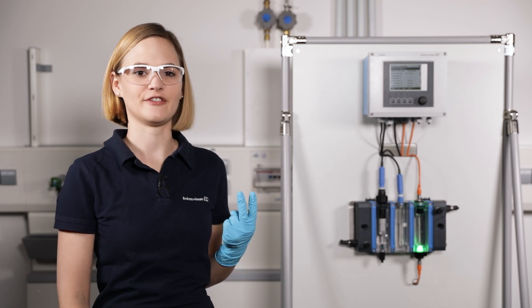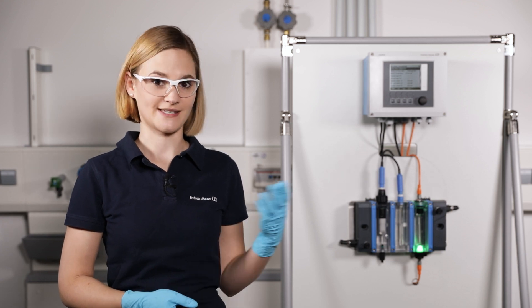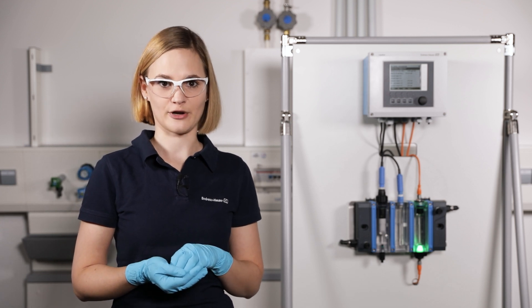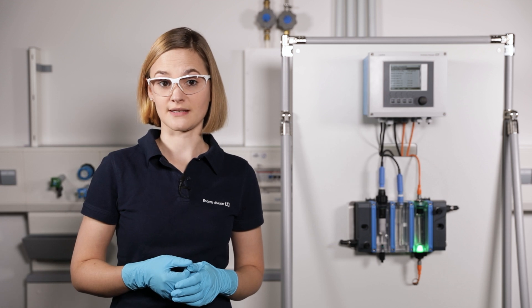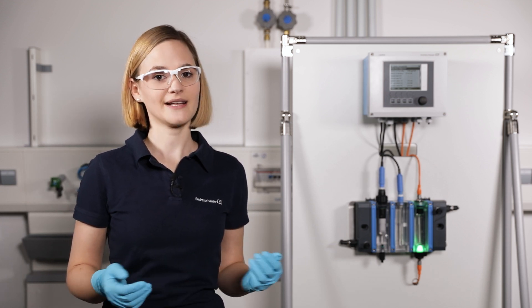A second very helpful feature is the electrolyte counter. It is supplied by all of our disinfection sensors. Once activated during commissioning, the consumption of the electrolyte in the sensor membrane cap can be monitored over time. If a warning limit is reached, a warning message ensures that the electrolyte can be exchanged in time.